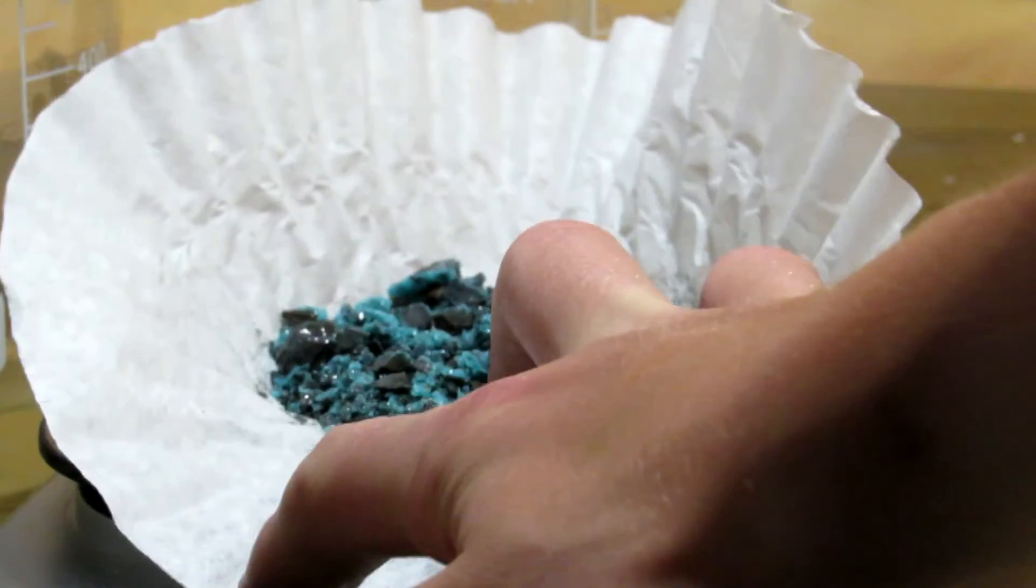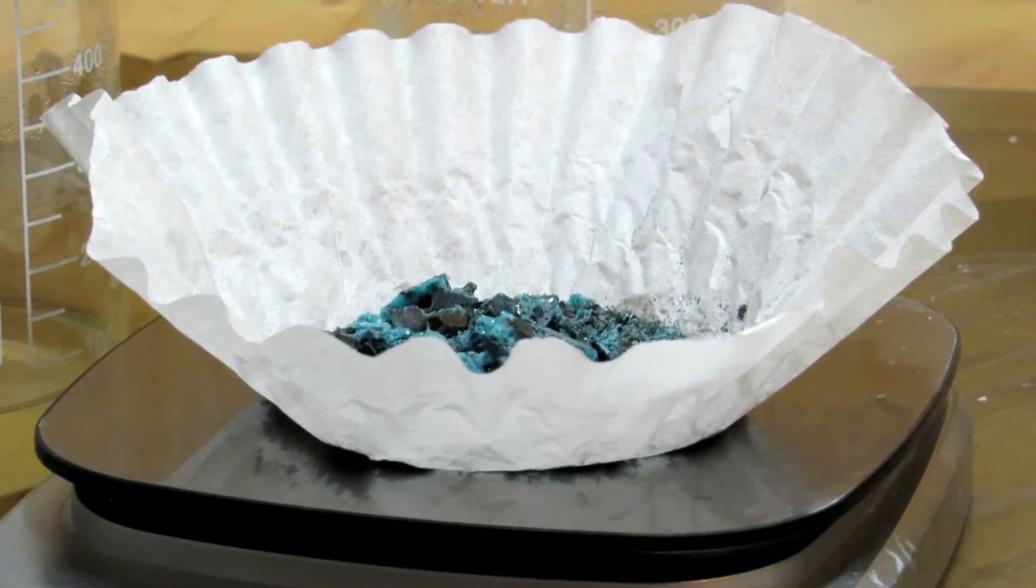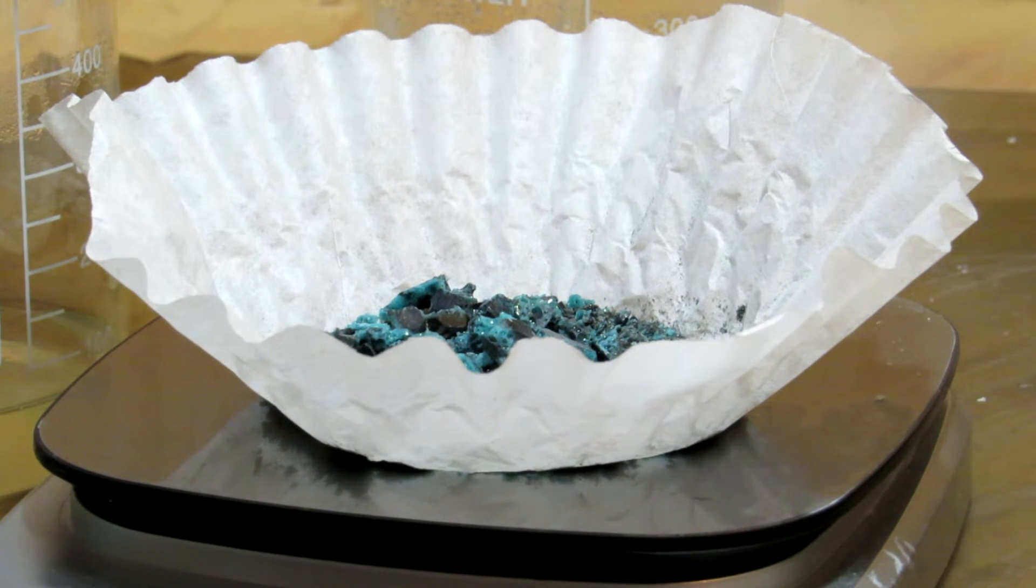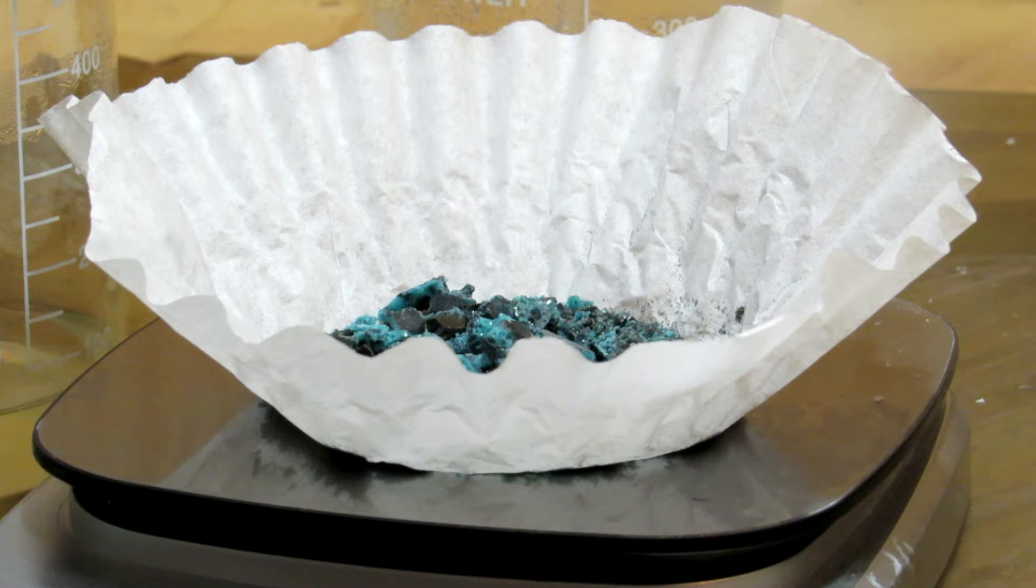So, after breaking all of this out of the crucible, we have about 42 grams of sodium hexametaphosphate, and we're definitely going to need more for an upcoming video when we make white phosphorus, but this is a fair amount for now.